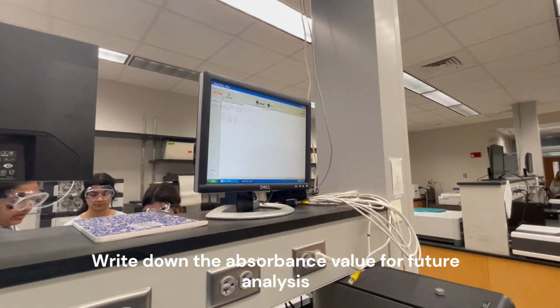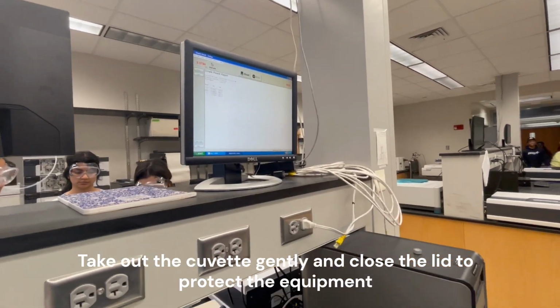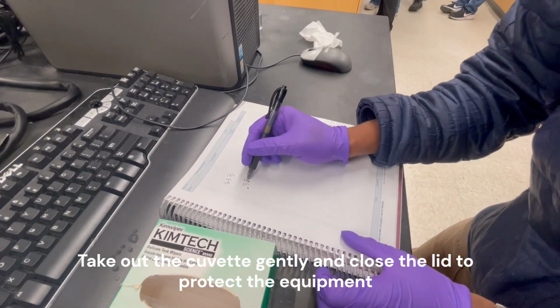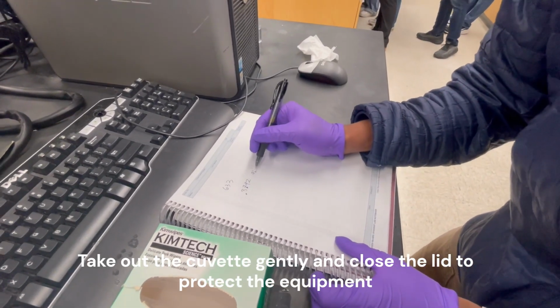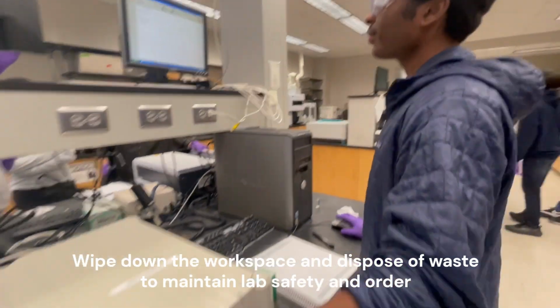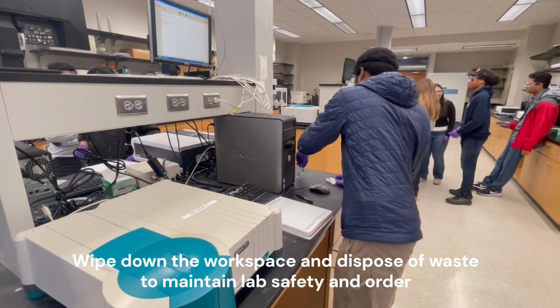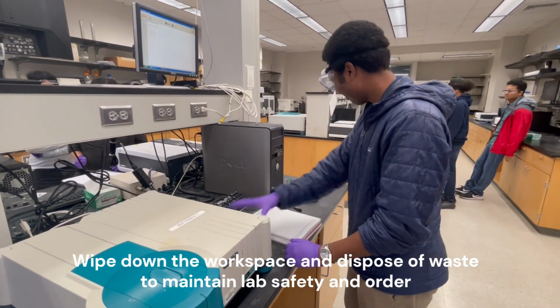Take a moment. Okay. And then take it out and clean up the station. There we go.